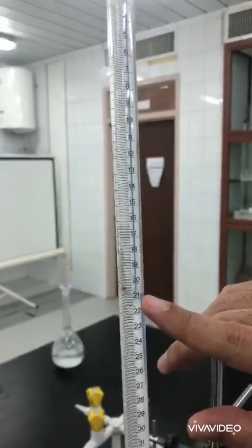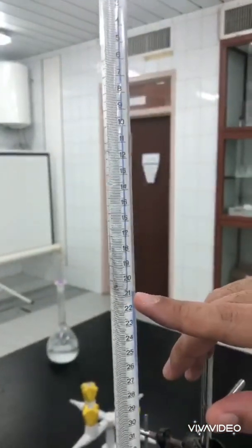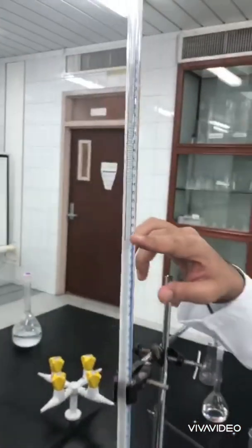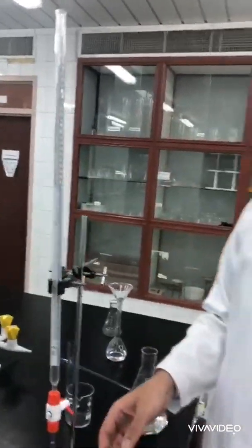Let's try the reading. Record the reading. The reading is 20.8 milliliters with H2SO4, while it was 11 or something like this with HCl. Now everything is ready. We collected the data required to complete our lab report. I'll explain during the class what we are going to do with the lab report and how to fill each item completely and correctly. Thank you very much.